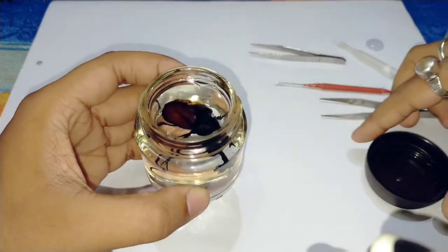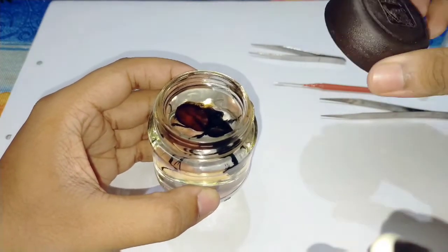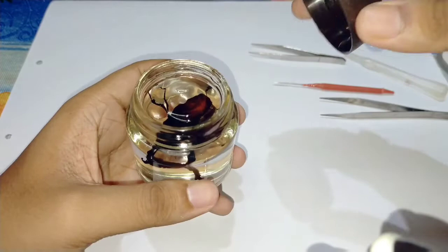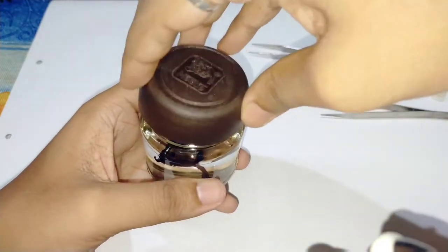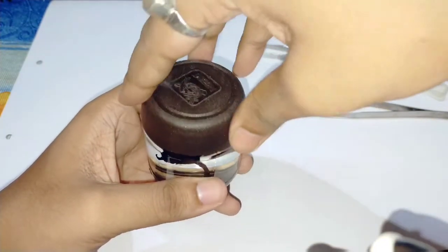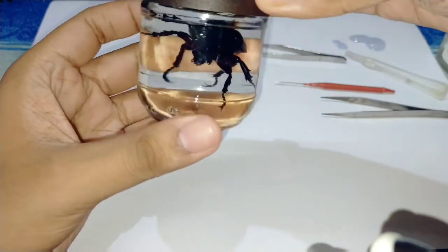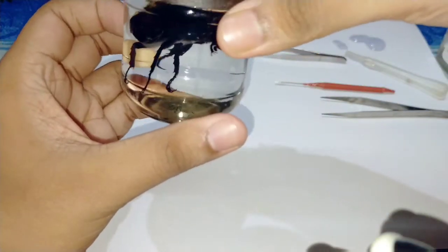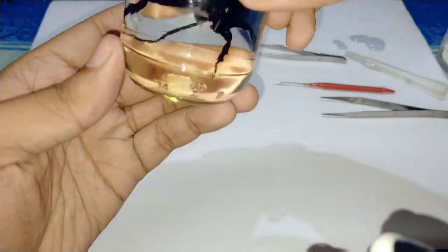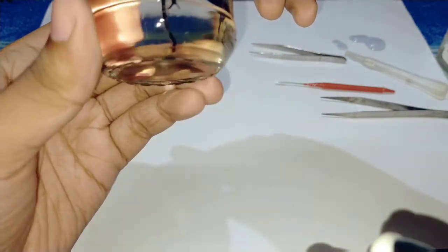After that, now fully close the container. You can see that our specimen is fully preserved.